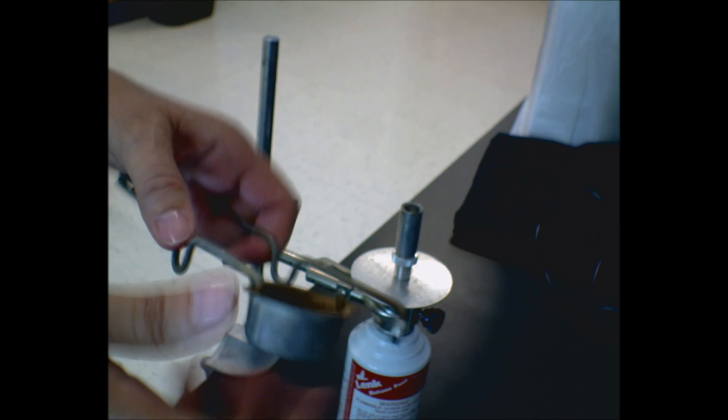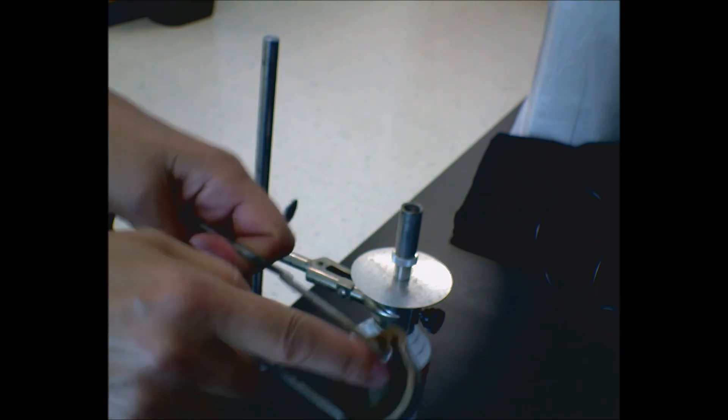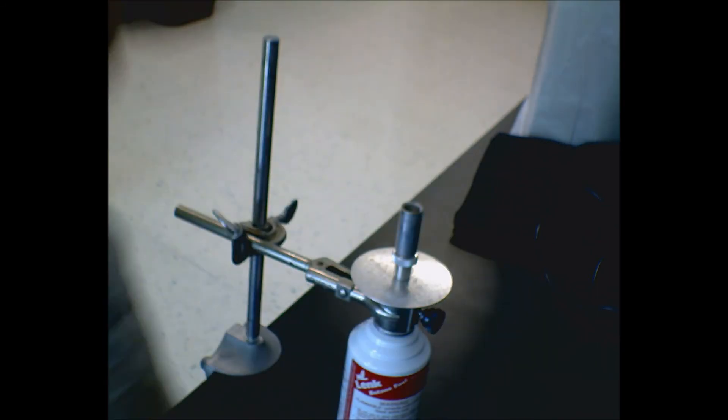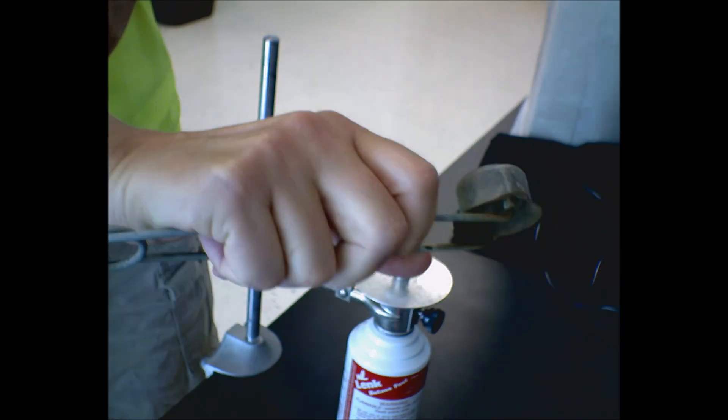So that goes in there. This part is all rough, and the goal is that when you do this, you get sparks.